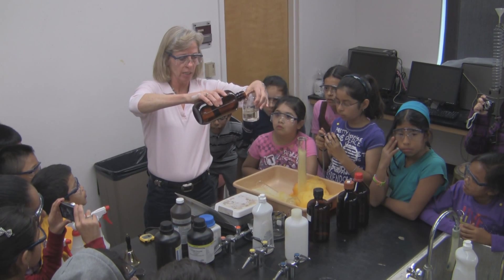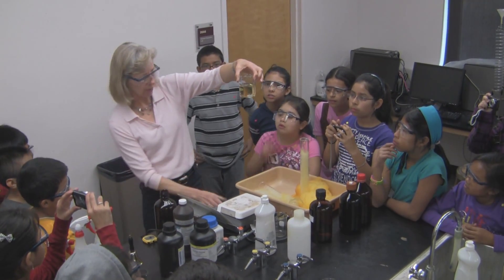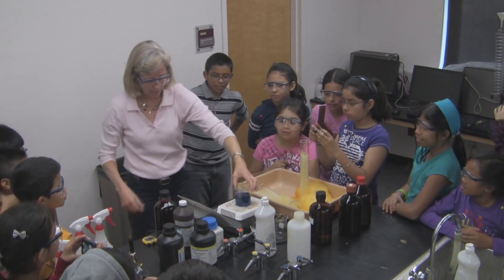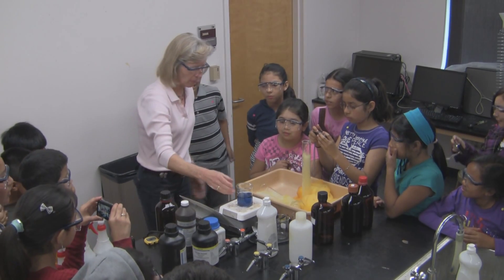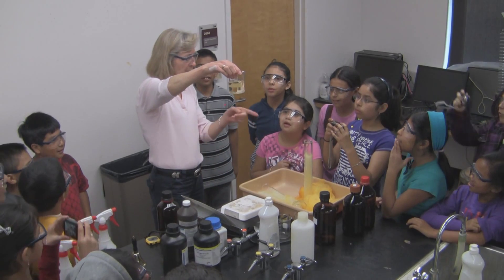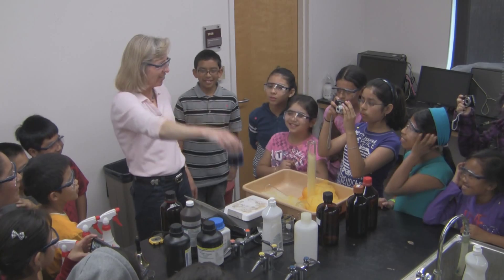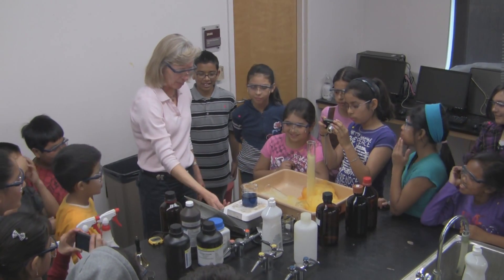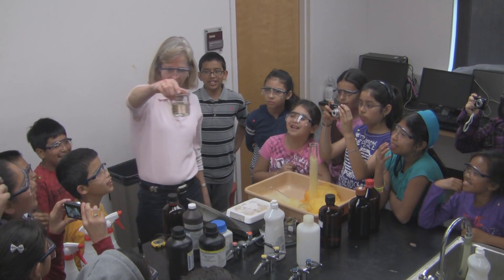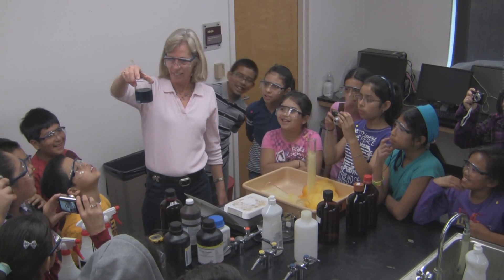Let's see if you see any reaction happening. What do you know when it starts? Oh! Do you see? What happened? It turned blue — or violet? Are you sure it's blue? It turned violet. If you guys can't make it in your mind, which color is it? It turned violet.